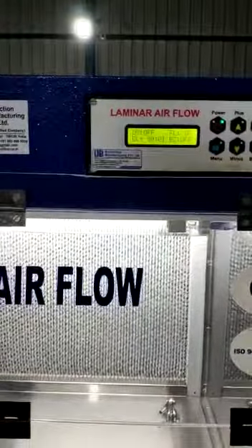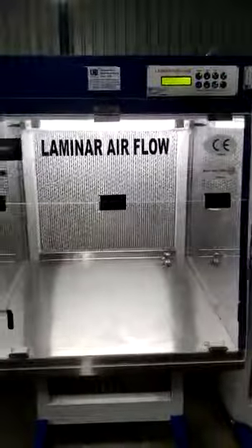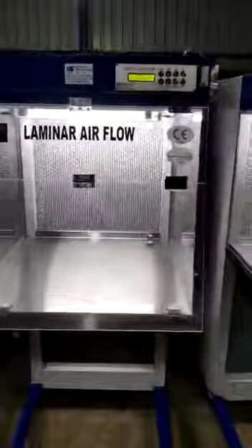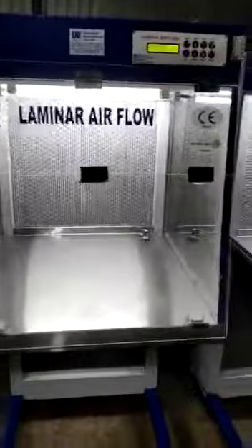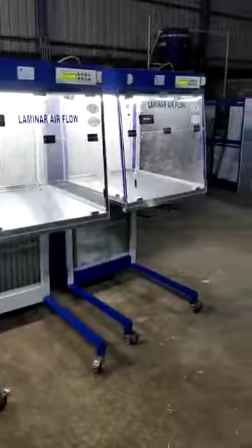Blower is off — there is a button. Blower on, blower off. Sound is there, blower is off, machine is closed. So this is how a laminar airflow is working. Thank you very much.